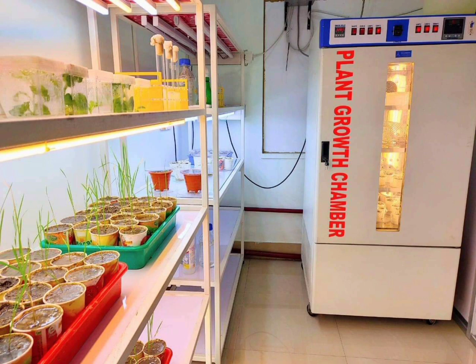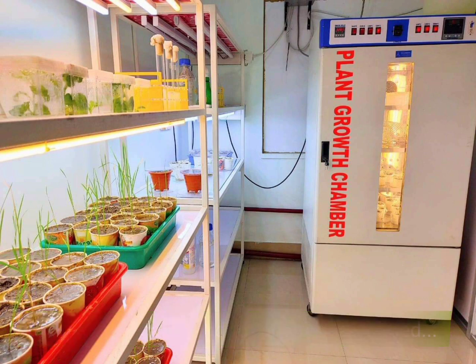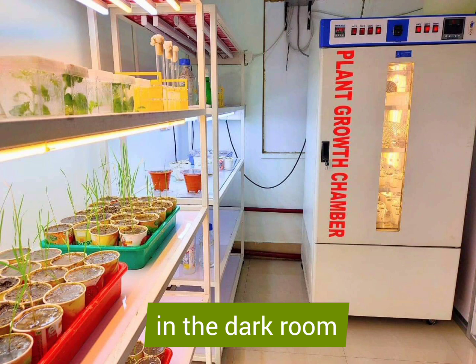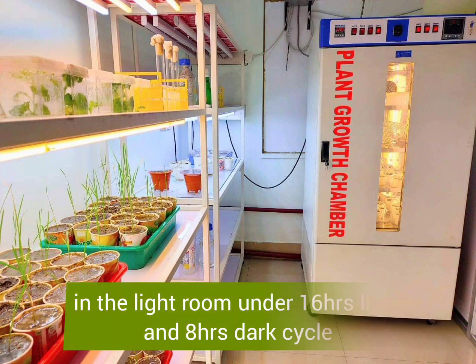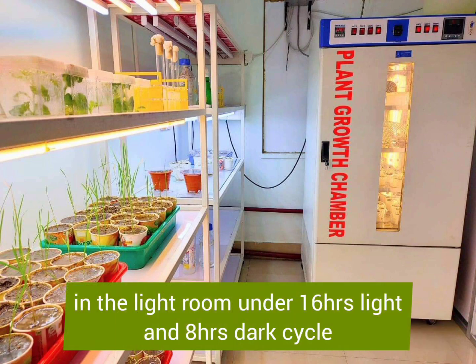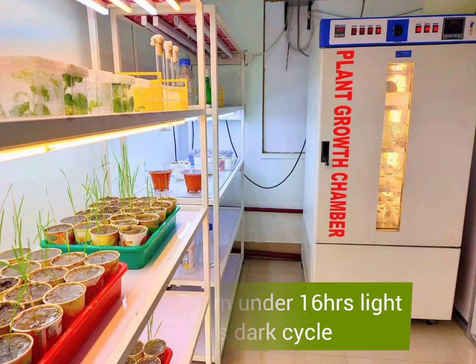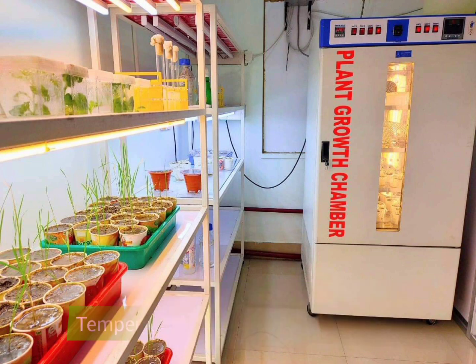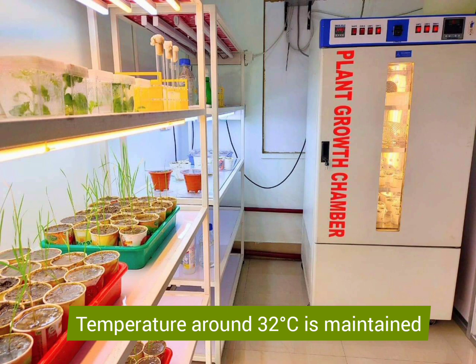For example, explants for callus induction are maintained in the dark room, while callus shoot regeneration is maintained in the light room under a 16 hours light and 8 hours dark cycle. A temperature around 32 degrees Celsius is maintained for rice.